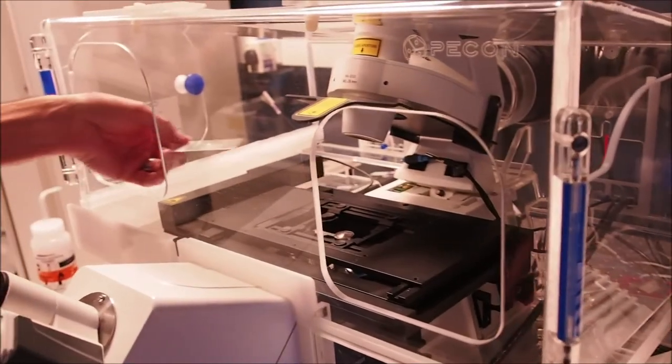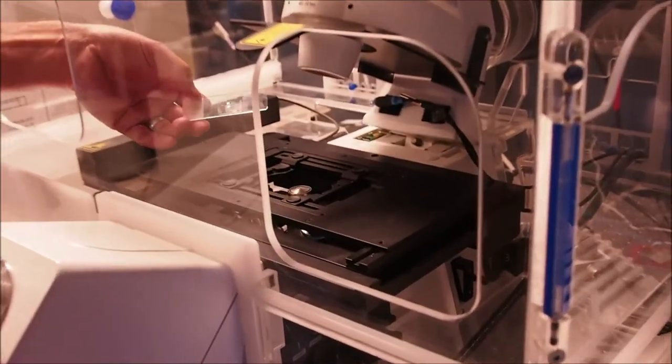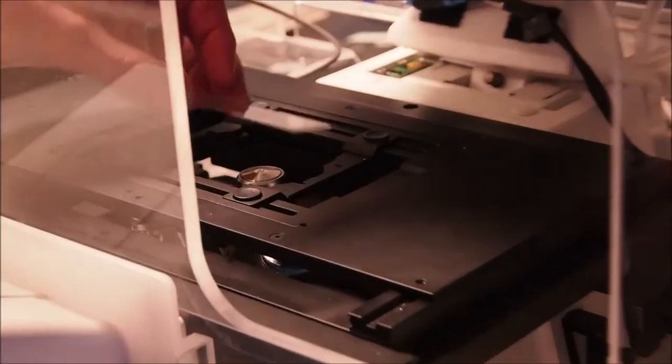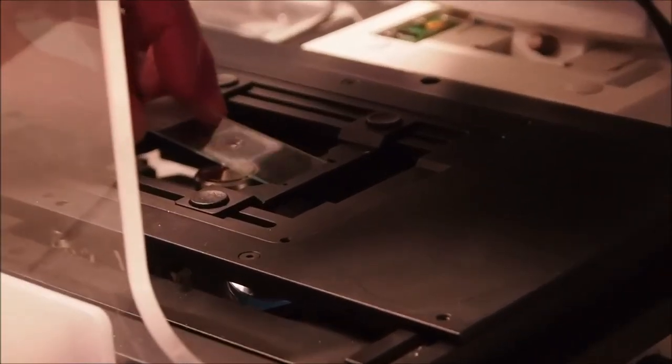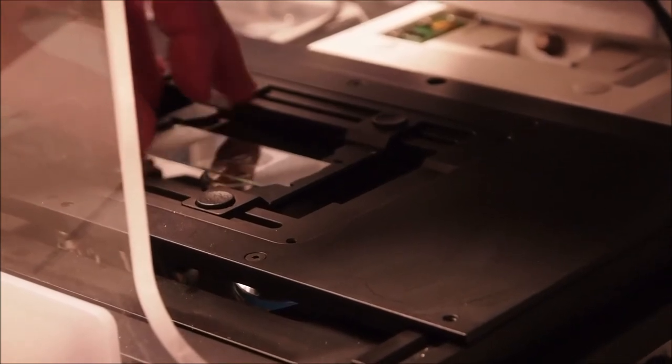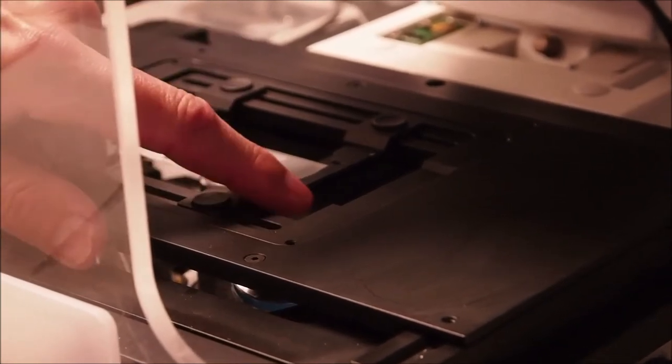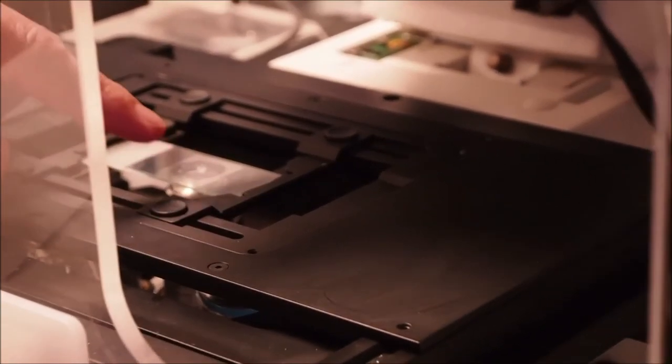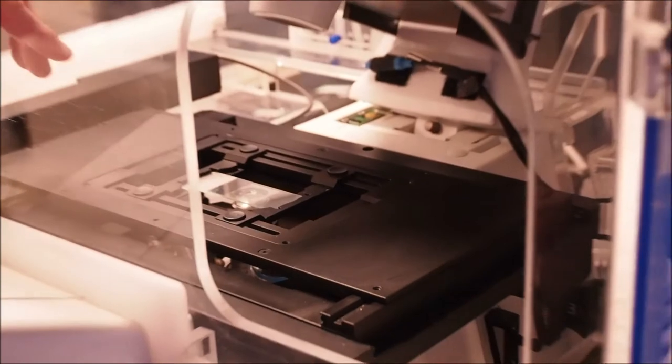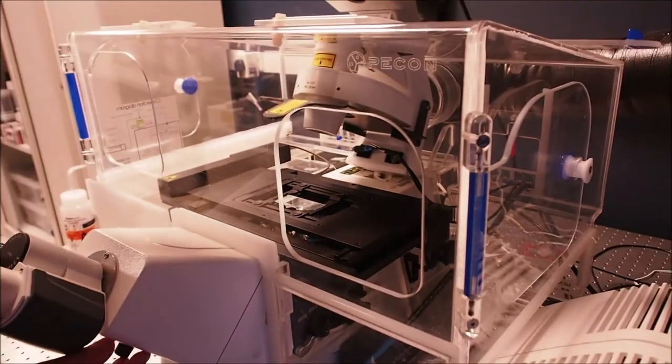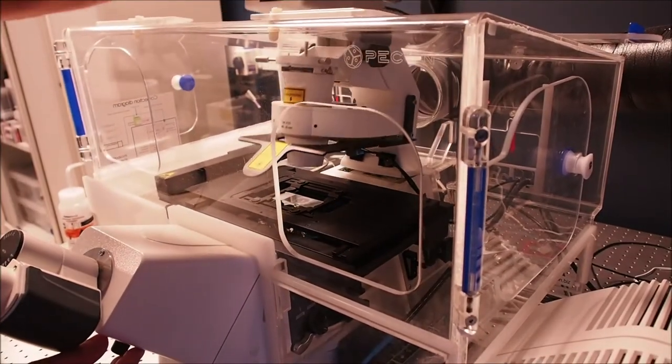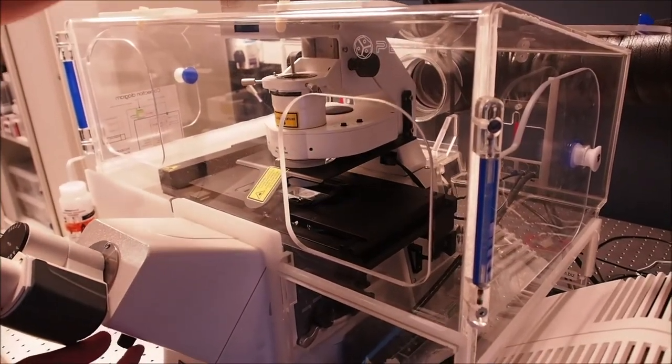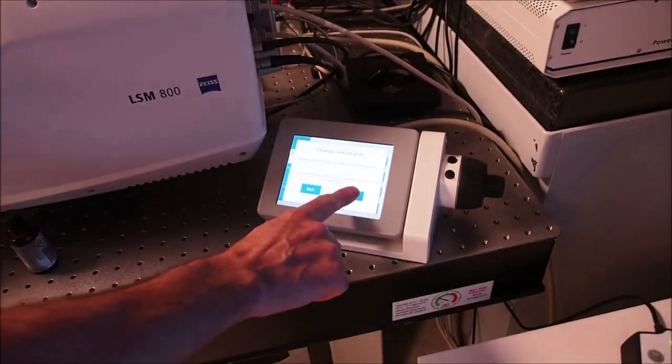Bring your sample to the stage and place the coverslip downwards above the oil immersion lens, pushing the holder together to clamp the slide in place. Bring the condenser arm forward and on the touch screen click done to move the objective back up to the approximate focal plane.